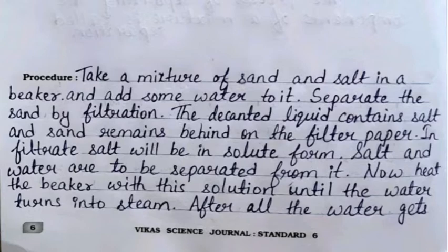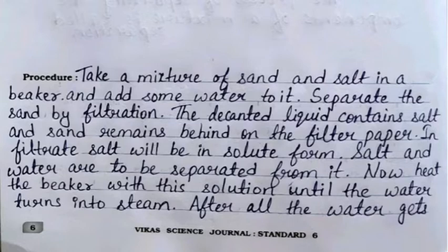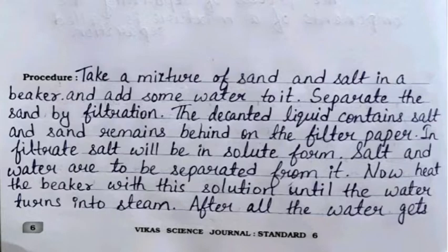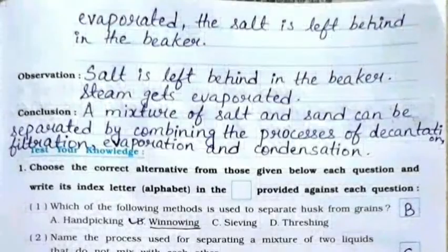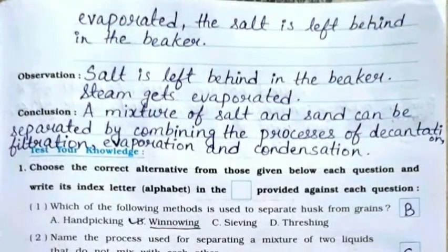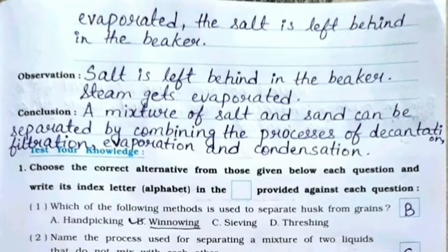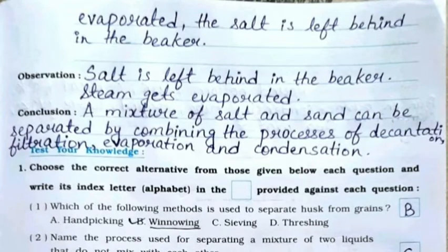In the filtrate, salt will be in solute form, and salt and water are to be separated from it. Now heat the beaker with this solution until the water turns into steam. After all the water gets evaporated, the salt is left behind in the beaker.